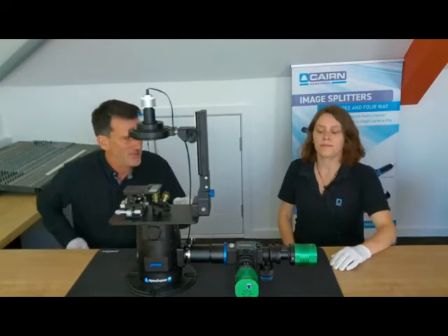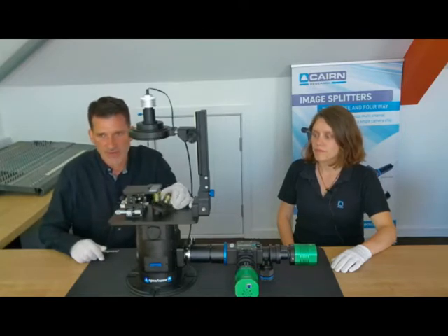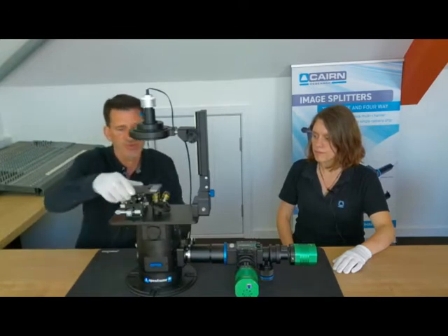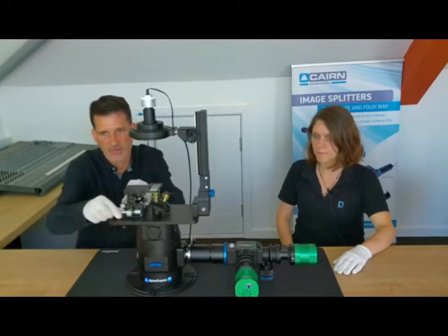Anyway, so this is a rather interesting configuration of the openFrame. The brief in this case was that we wanted to be able to have more than one objective, so we had to make an objective carousel available. We also had a target of making it quite affordable and compact, so we stuck to this very squat configuration. We've dealt with the sample preparation by designing and building a magnetic slide holder with X, Y, Z micrometer control of the sample.